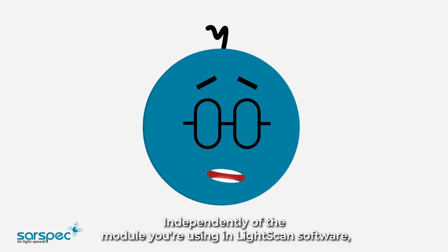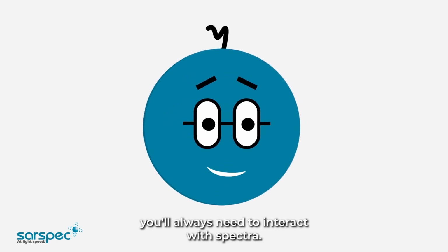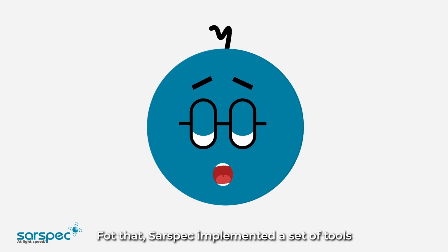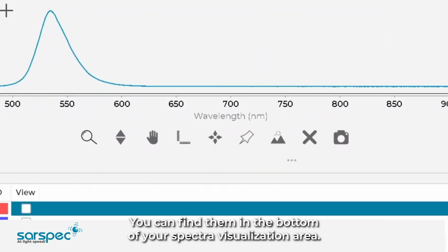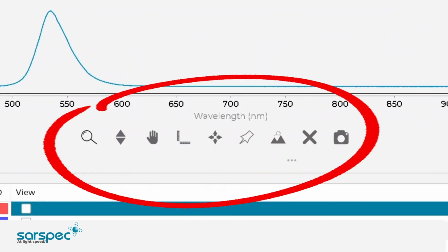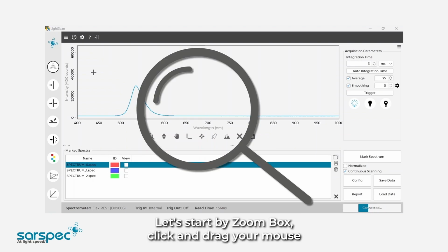Independently of the module you are using in LightScan software, you'll always need to interact with Spectra. For that, Sarspec implemented a set of tools that will make that interaction really easy and simple. You can find them in the bottom of your Spectra visualization area. Let me explain them individually. Let's start with Zoom box.